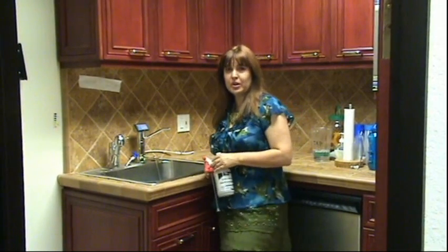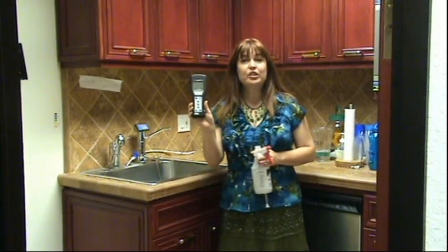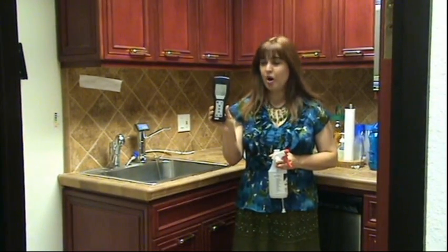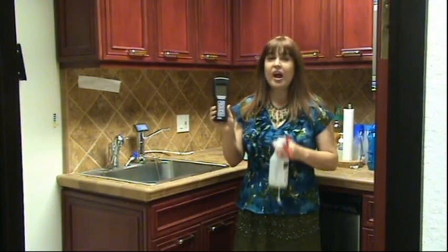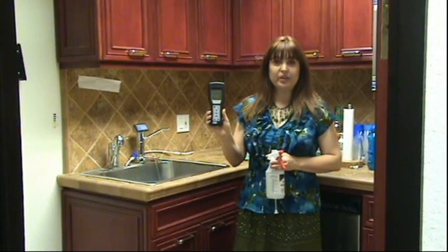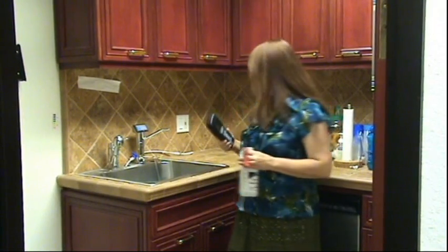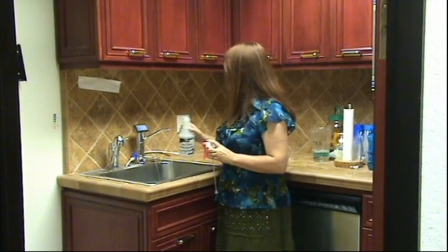So now we're going to do a demonstration. It's really thrilling for me. We have some friends that own a bacteria meter that's made for the health department. This meter costs $1,000. Our friends have done the test before, but I've never done this — this is going to be my first time. I've heard that it works really well, and they've generously loaned it to us. So we're making acid water fresh for you.